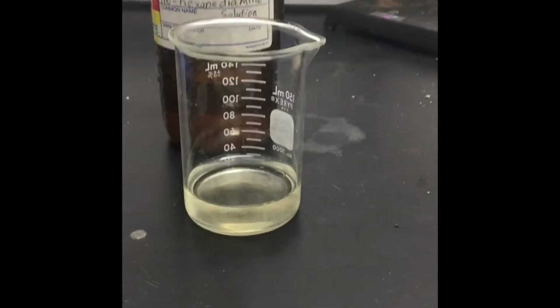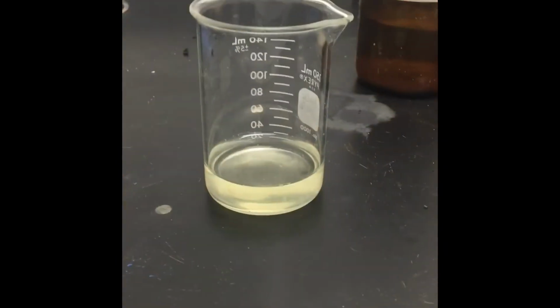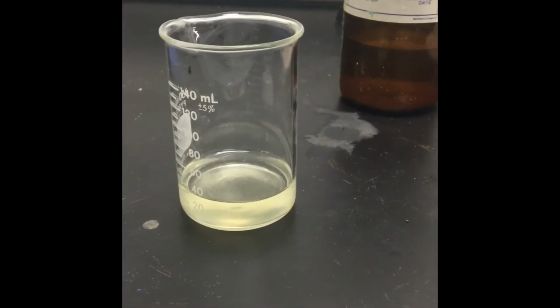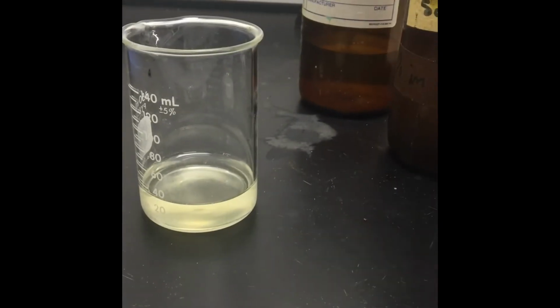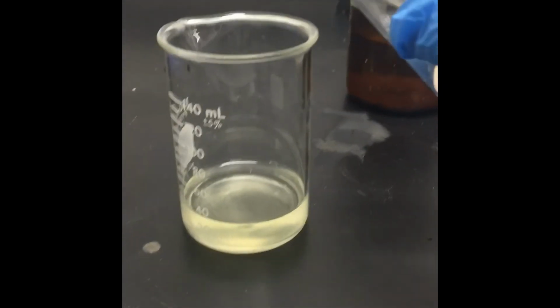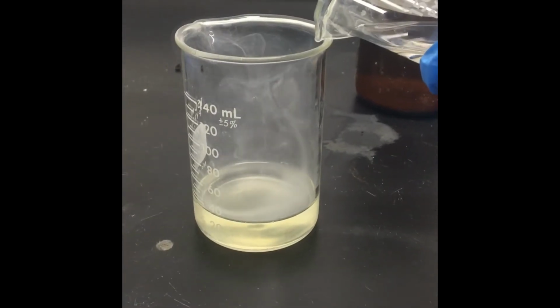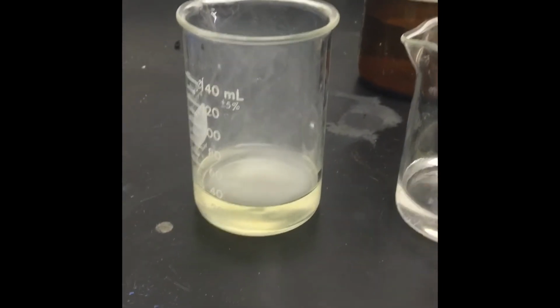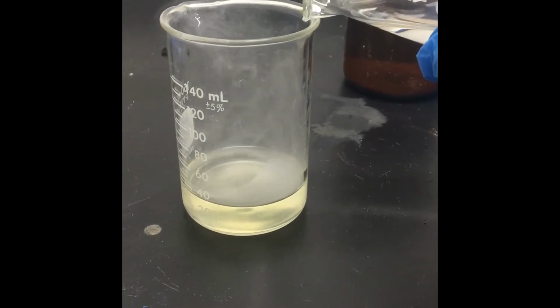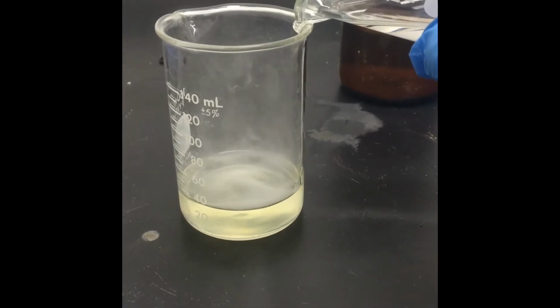So let's see how we're going to make this. Like I said, right here I have about 30 mils of this 1,6-hexane diamine. And what I'm going to do right now, very carefully, is add the other compound, which is the adipoyl chloride. So I'm going to do it very carefully and see what happens. Oh, you can see that it's already smoking. So already a reaction is happening. Oh, let's actually watch that. That's pretty cool. So I'm going to start adding. Oh, look at that. Even the vapors are recognizing that I am adding another compound. So I'm going to add this very carefully.